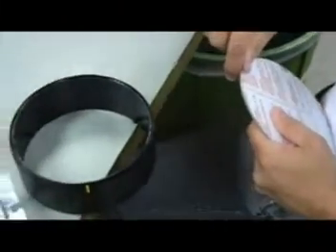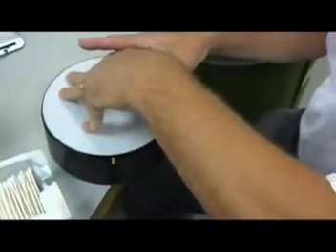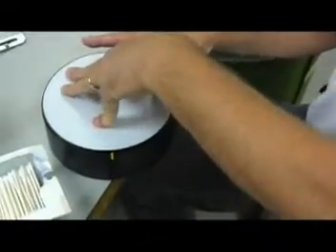Let's take our polycarbonate disc now. You'll probably need your razor blade again to peel off the protective covering only on one side. And then we'll take the side that we just uncovered, have that facing down, and we will press the cover into the holder.